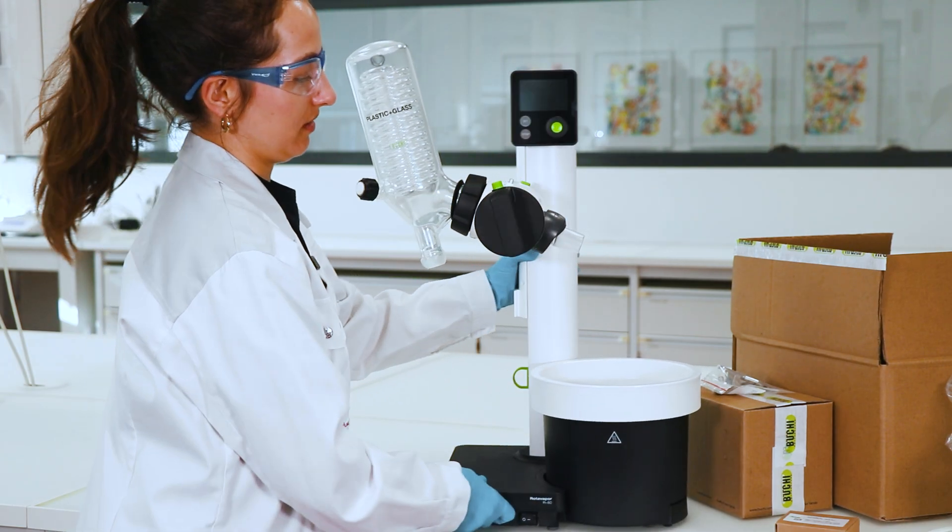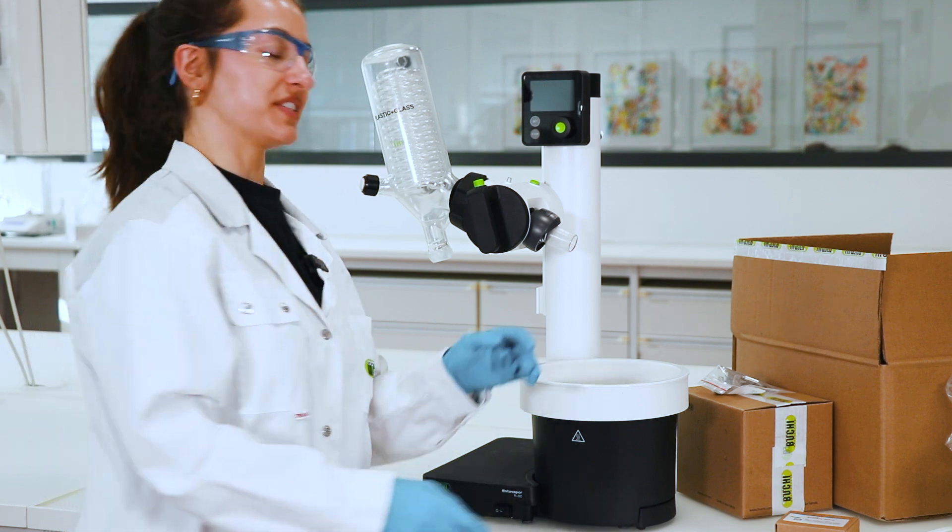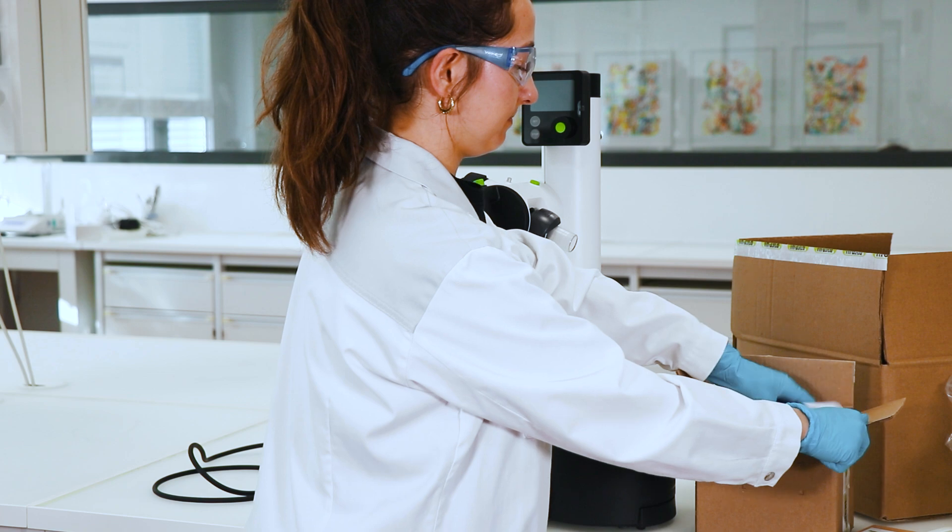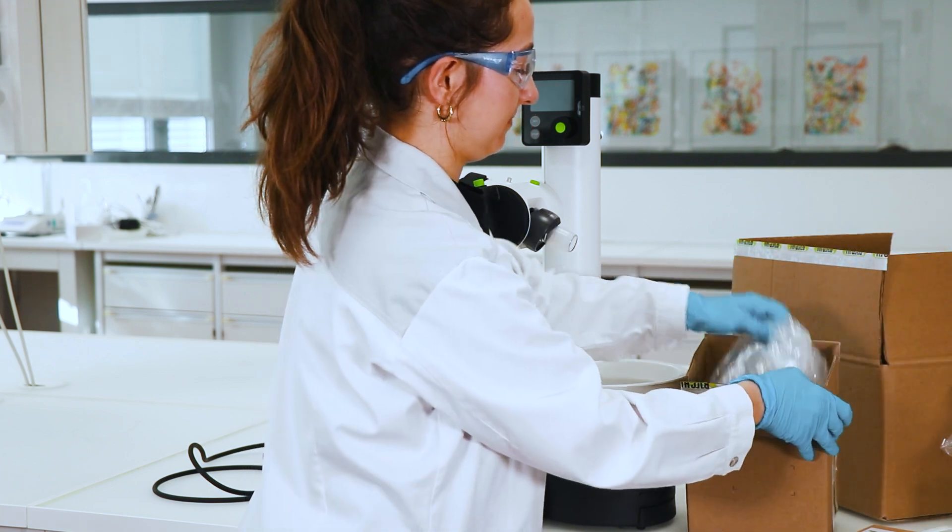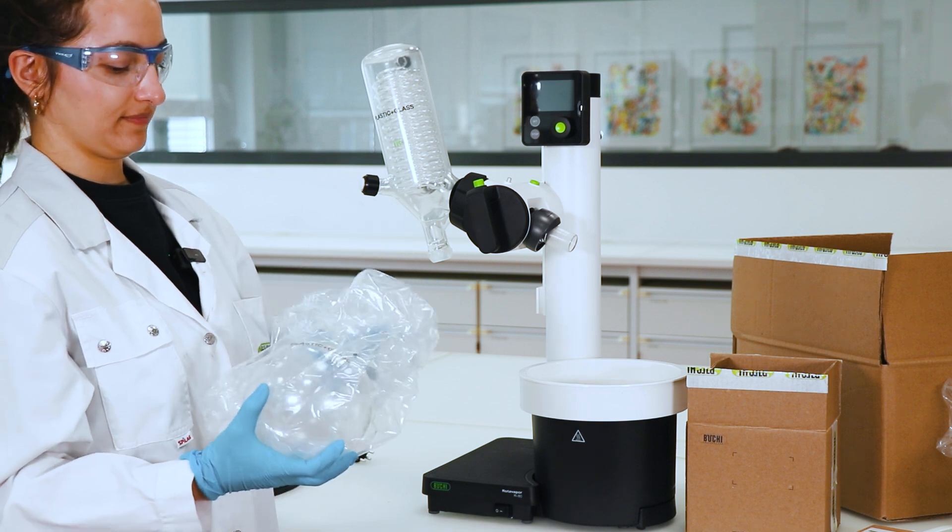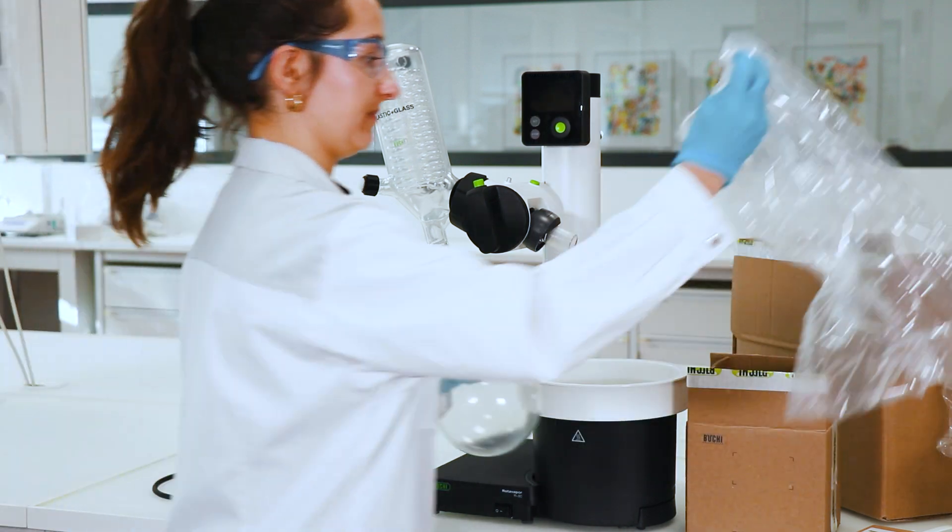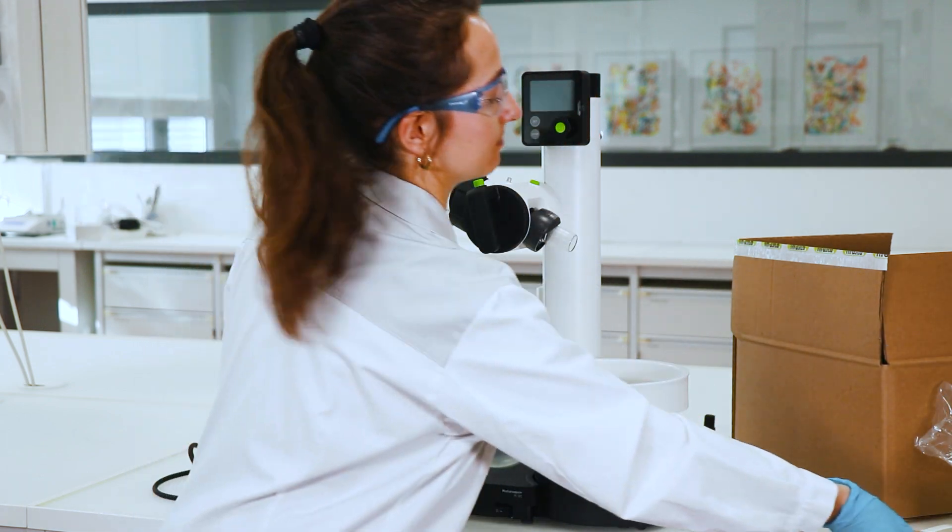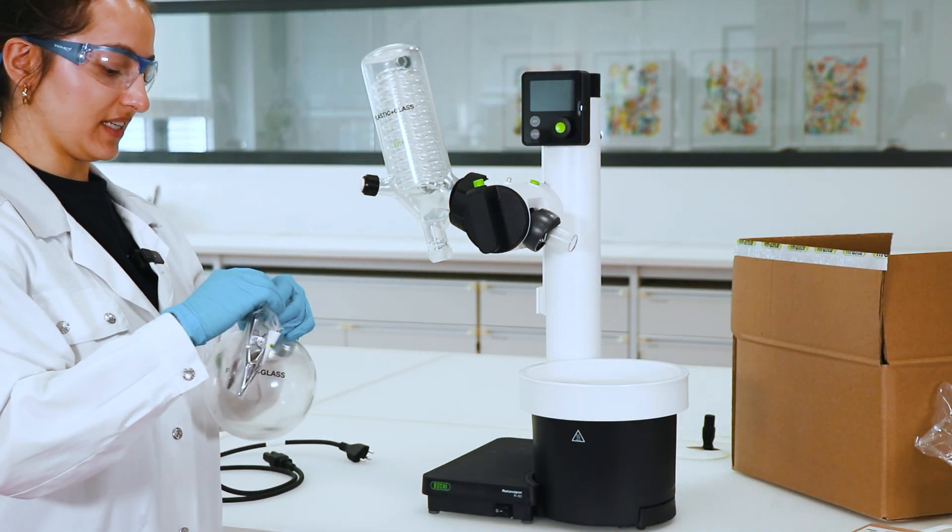So then the next thing is the receiving flask. And we need this clamp here to attach it.